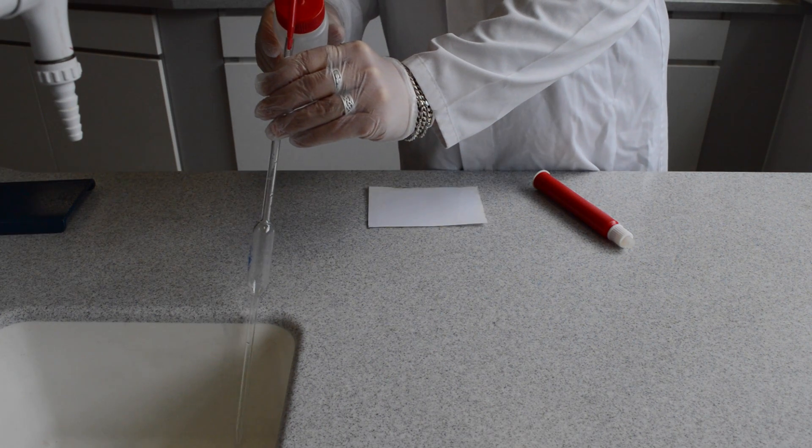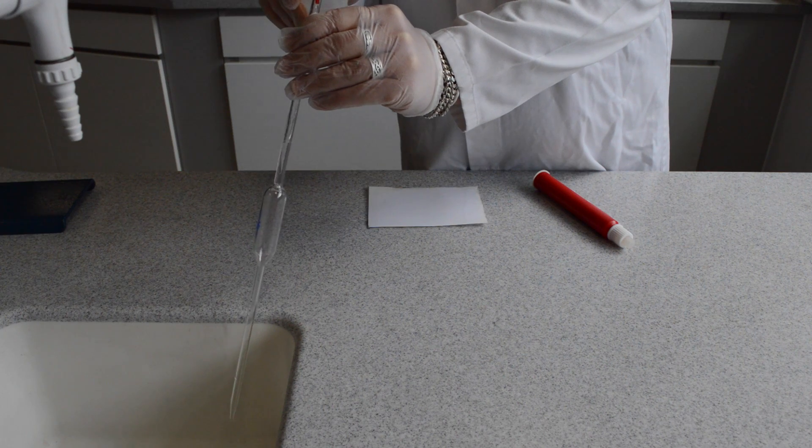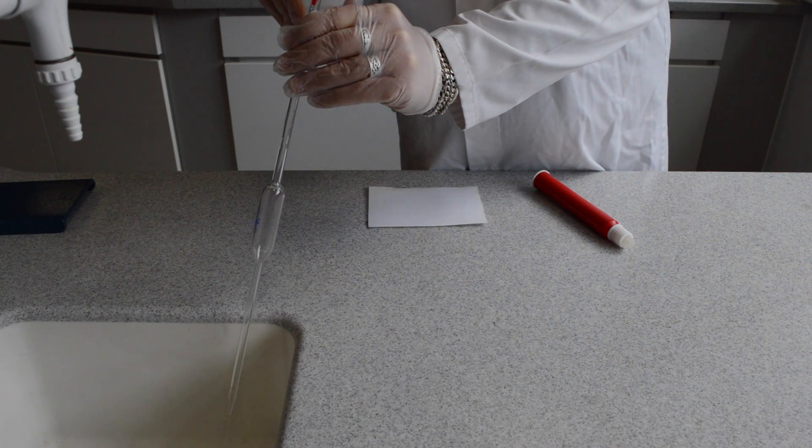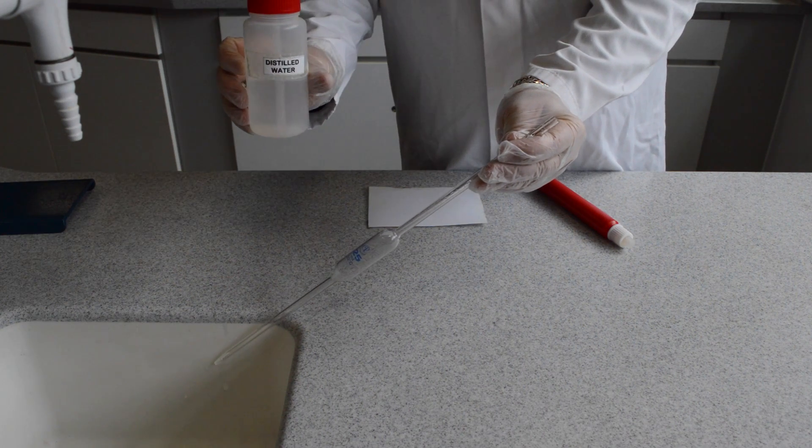Conditioning equipment. This procedure is used to avoid contamination during the titration as the equipment may have been used for other substances before. The equipment needs to be washed through with distilled water.